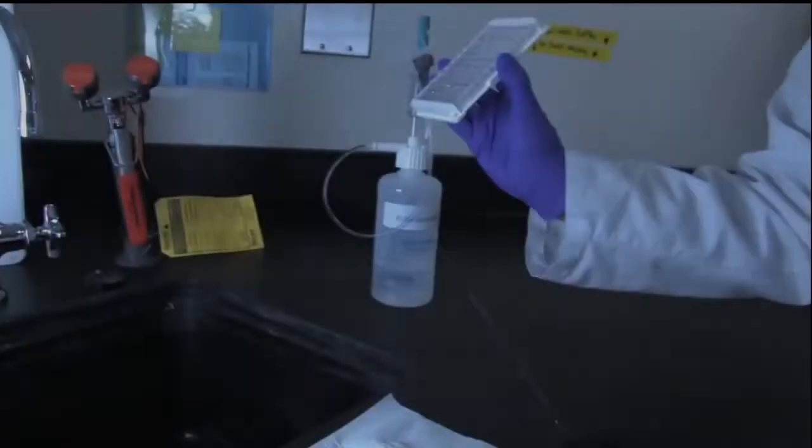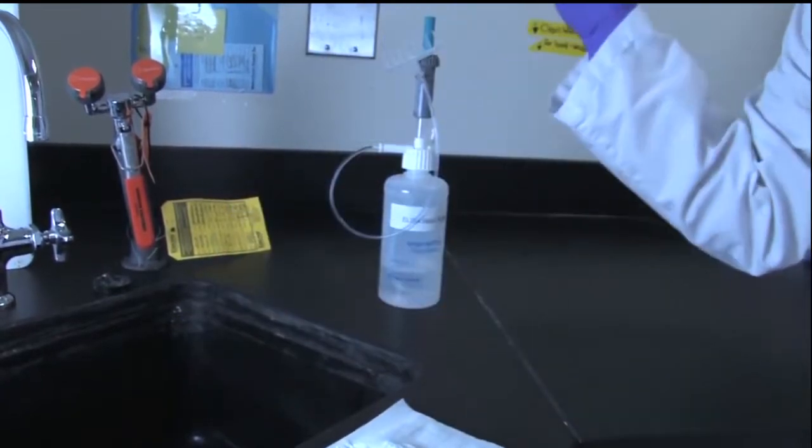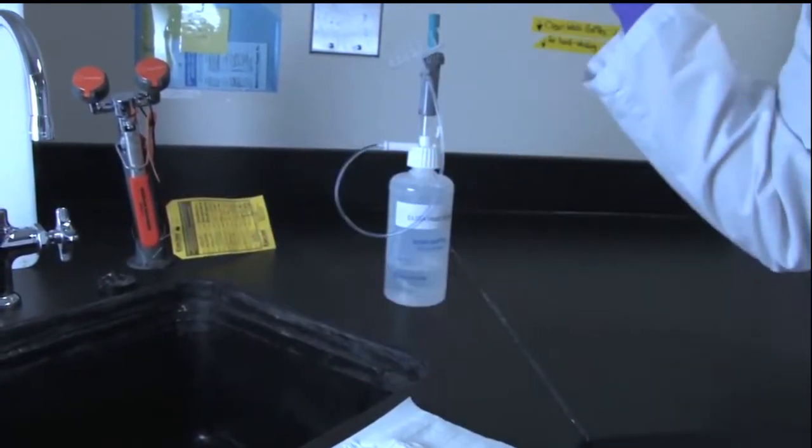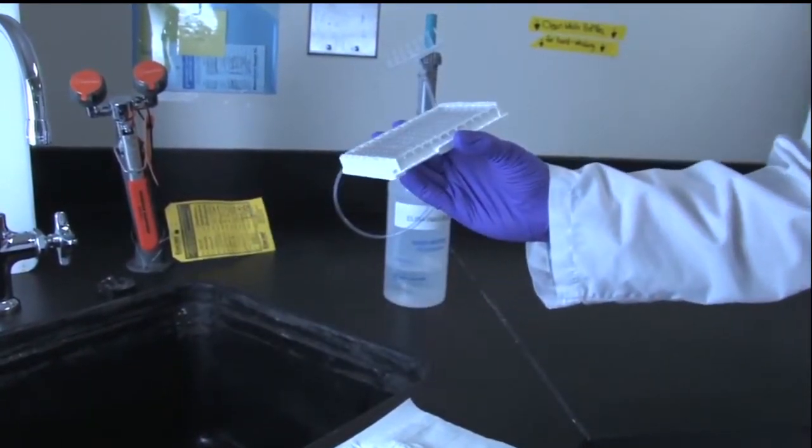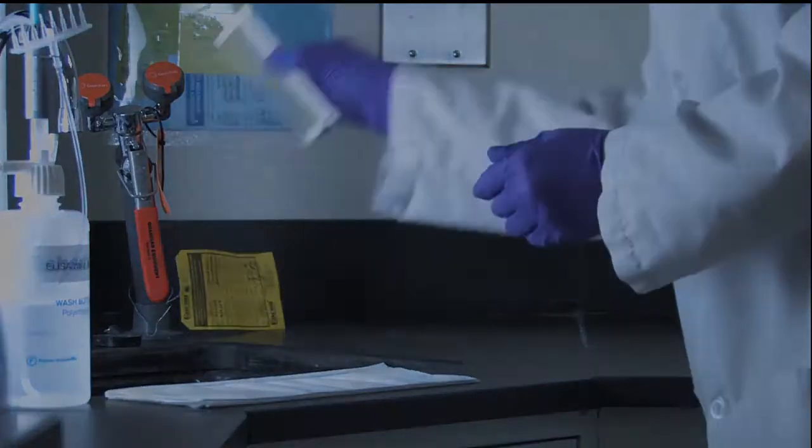Discard the contents of the wells using an angular and forceful motion. Due to surface tension, we recommend using the angle and motion shown in order to properly remove all liquid content.